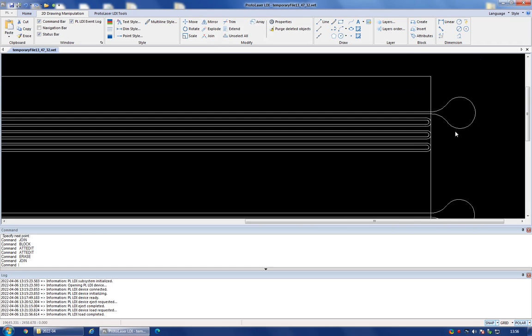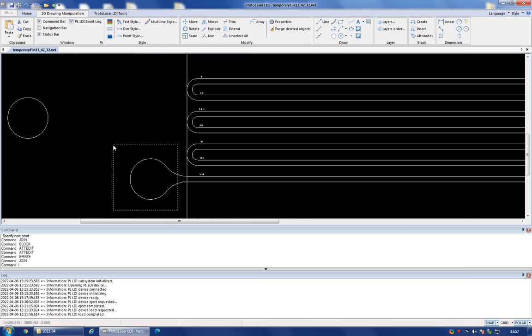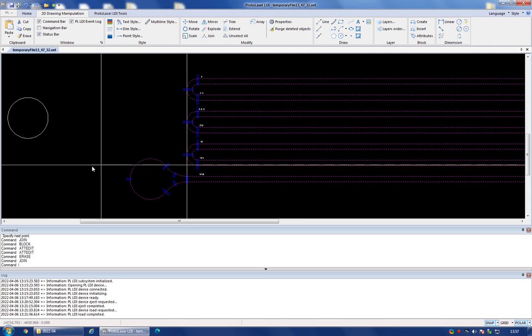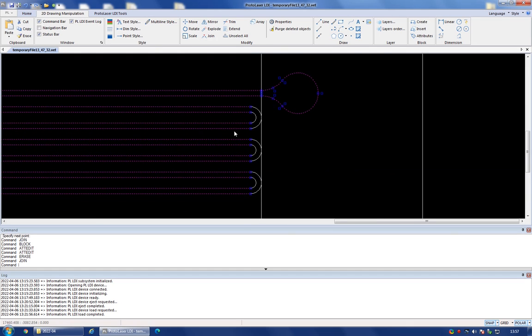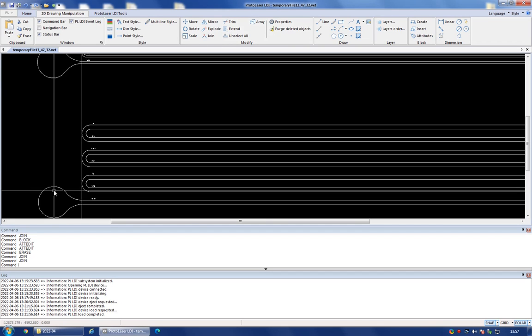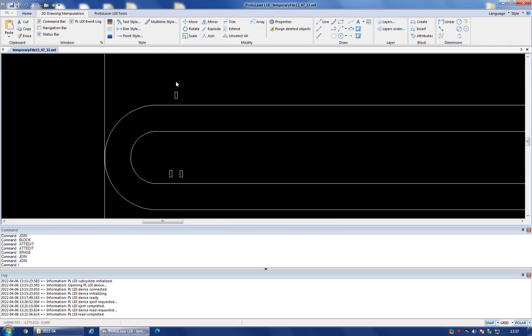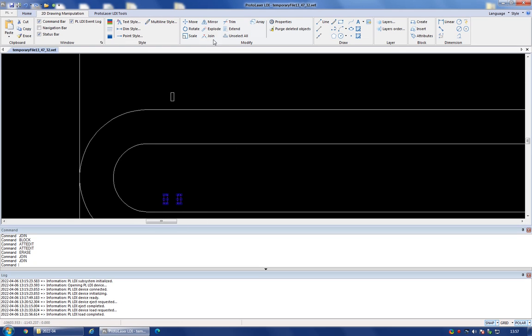Okay, so that's what I wanted, and I'm going to do the same thing with the one below, which is just a slightly different size of the channels. And that's it. And so now I can hit the join button, and that's going to be part of the one shape. So you see now that I've got the lettering here. I would like to select all the letters and hit the join button, but unfortunately that will not work. You can only join one shape at once.